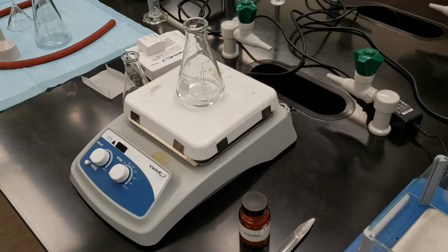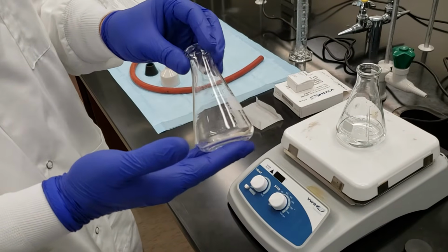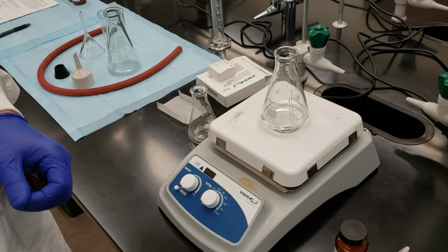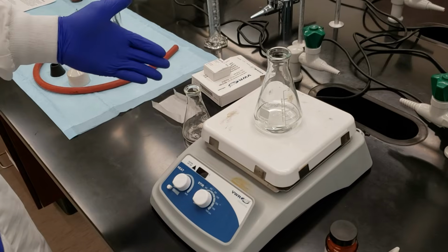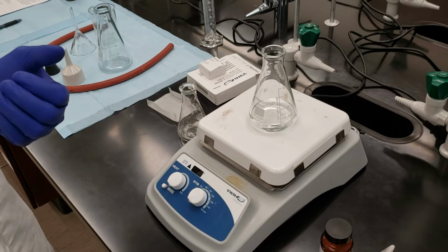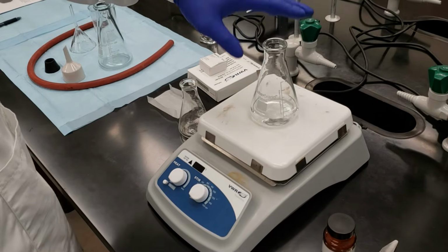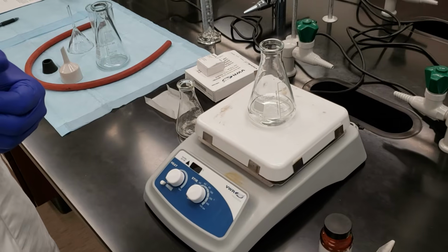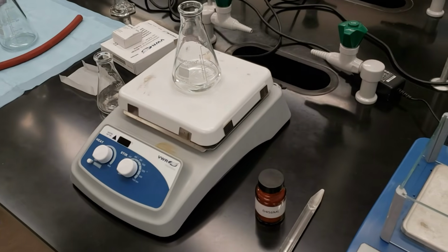So the idea here is that we're taking two solids that have been mixed together. We're choosing a solvent system that will dissolve one of those two solids, but not the other at high temperature. In this case, the sand will remain insoluble. Our unknown compound will dissolve into our hot water, and then we'll be able to physically separate them via gravity filtration. We'll revisit that once we've actually gone through the process, but that's how we choose our solvent system, finding something that is able to separate these two compounds from one another based on their solubility at high temperature. So we're going to go ahead and heat this up to a boil and come back.